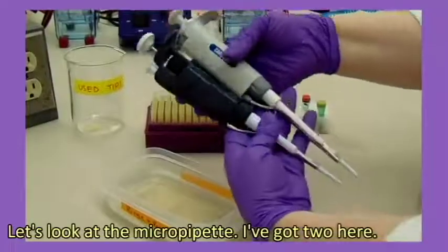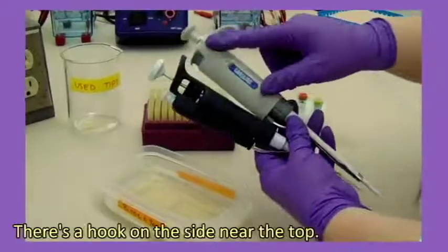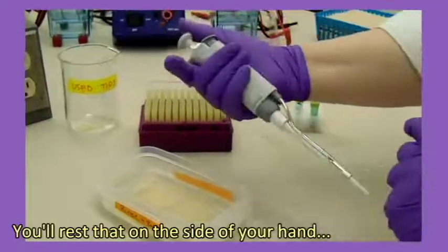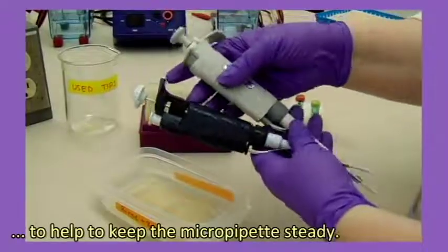Let's look at the micropipette. I've got two here. There's a hook on the side near the top. You'll rest that on the side of your hand to help keep the micropipette steady.